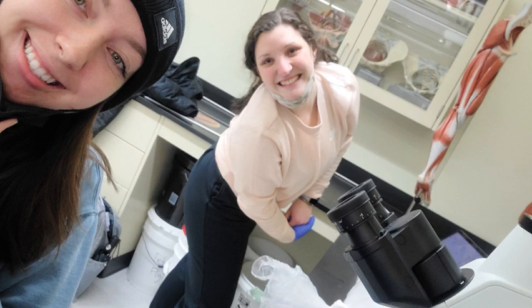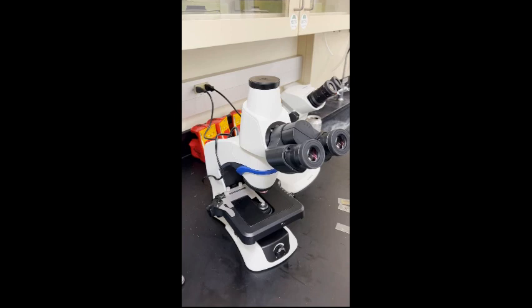In this lab video, we will be demonstrating how to set up a slide on a compound microscope. We will also be explaining and identifying the 5 chordate characteristics in a tadpole, Ammocoetes, adult lamprey, Amphioxus, and by dissection, a sea squirt. Finally, you will learn why these chosen invertebrates were studied in this lab and how they relate to understanding vertebrate evolution.